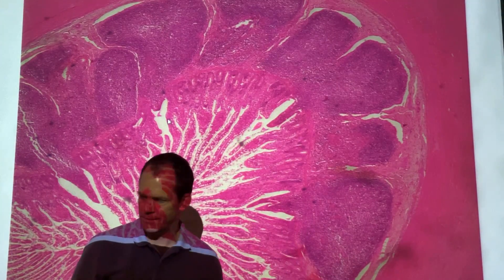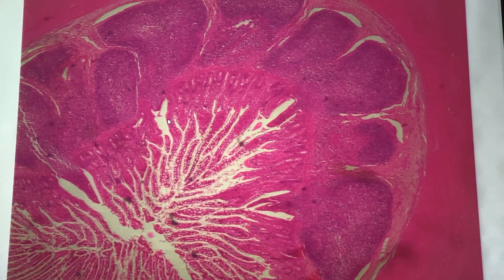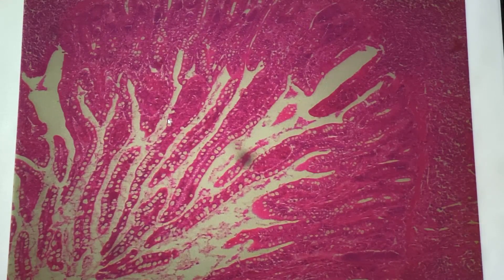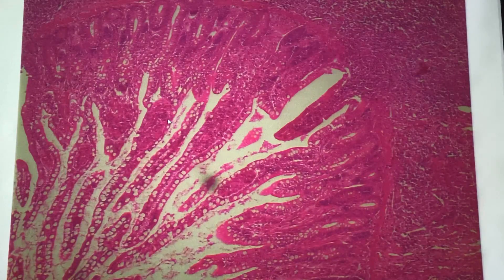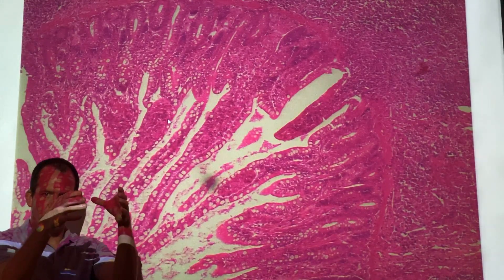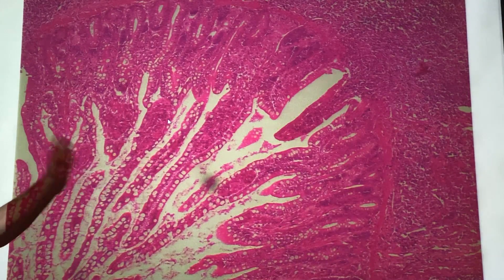So for the ileum: lymphatic nodules, Peyer's patches, goblet cells. Let me zoom in and try to find the goblet cells. Zooming in here, you see those hollow, white, clear spots? Those are goblet cells. Goblet cells produce a mucus that they secrete — they're called goblets because they look like a goblet, like a glass. And those are just those hollow spots.